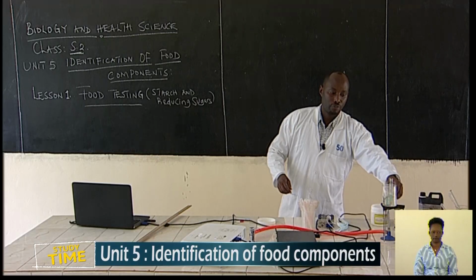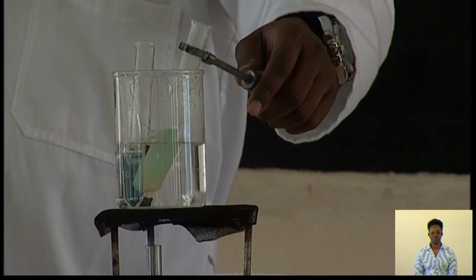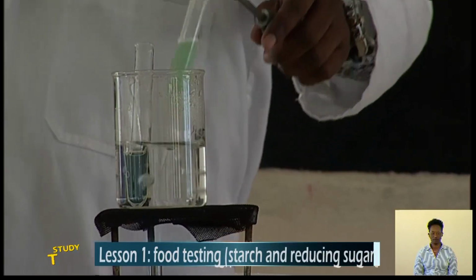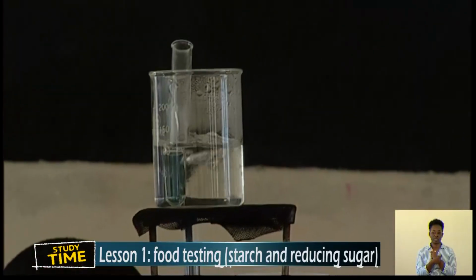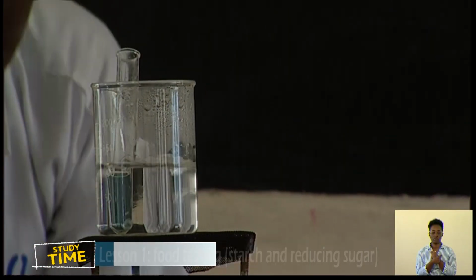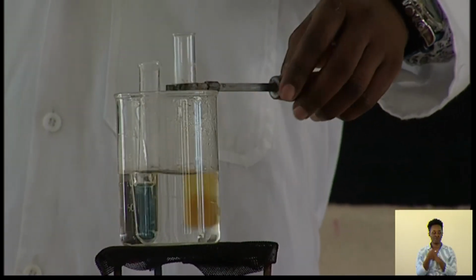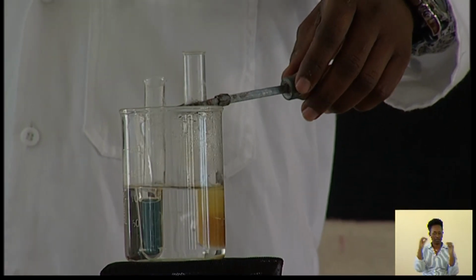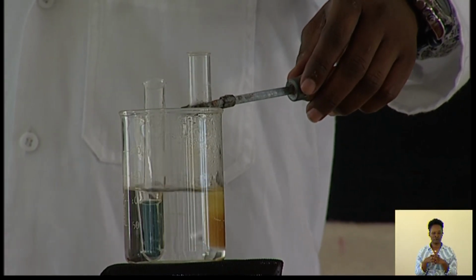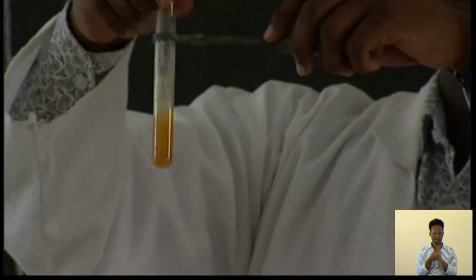The color is changing to green. Then from green, it will change, as you can see. Then we try to heat and observe very clearly and see what is happening. Automatically, you can see something is changing.